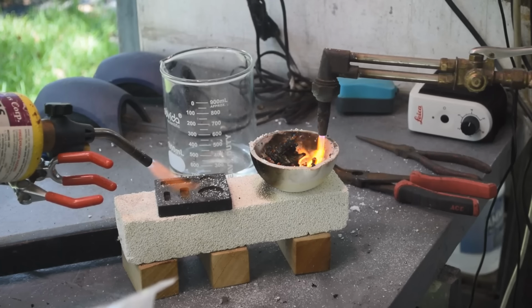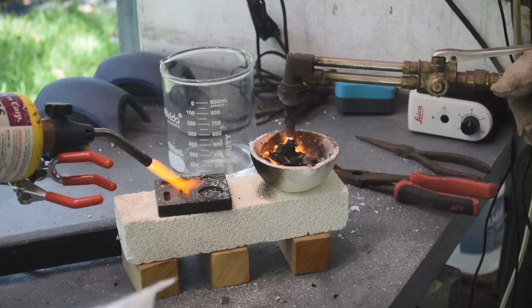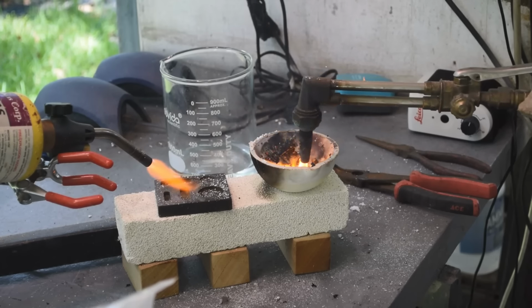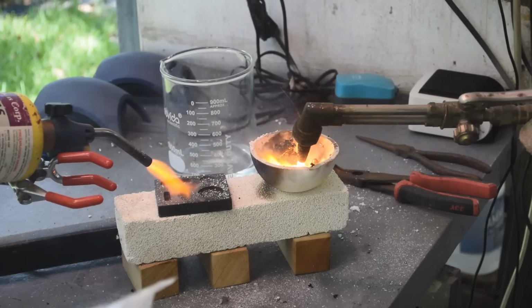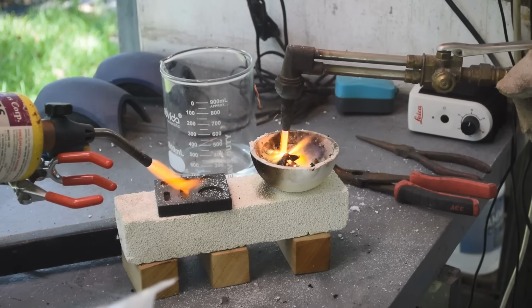We're getting down to it now. There's not much left, but palladium metal, a little bit of paper ash left in there. The filter papers were wet, so they're taking their time burning off, but we're getting down to the metal. I can see the metal now.